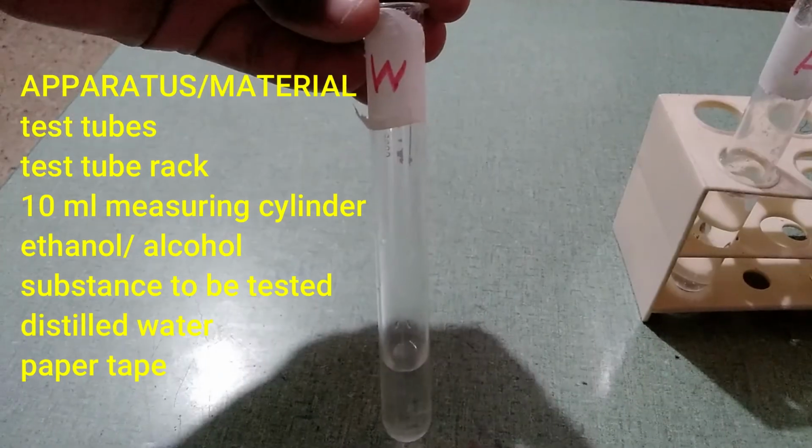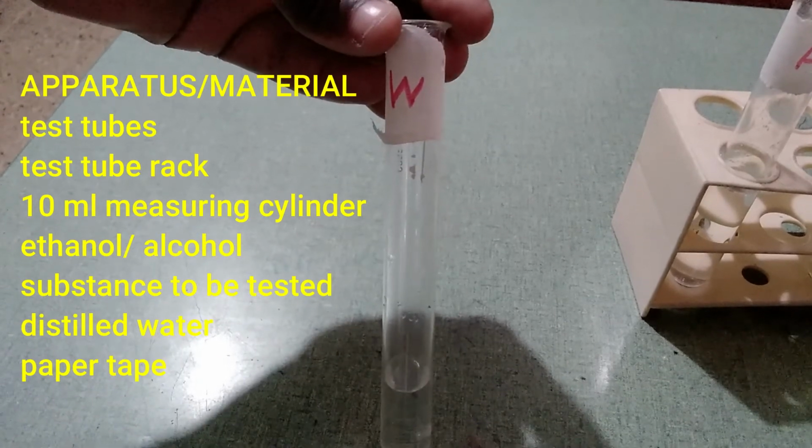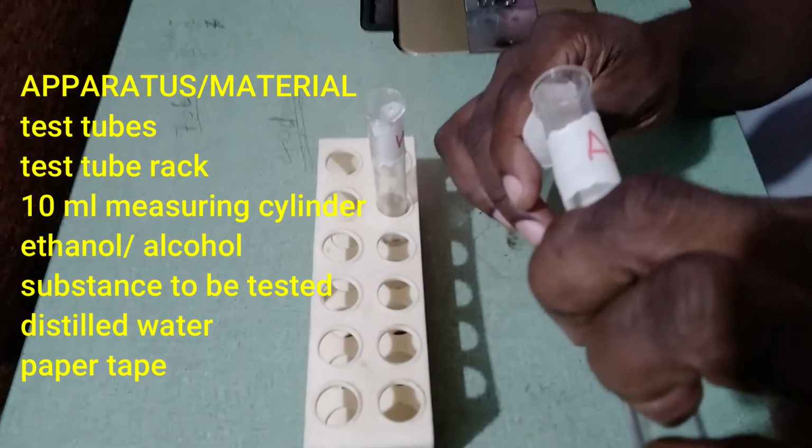Test tube rack, 10 ml measuring cylinder, ethanol or alcohol, food substance to be tested, distilled water, and of course paper tape that we have used to label the tubes.